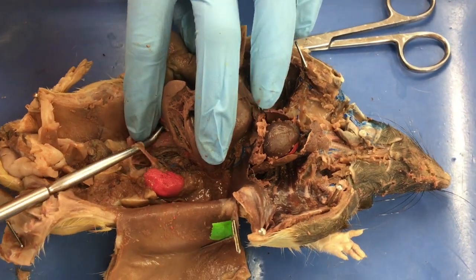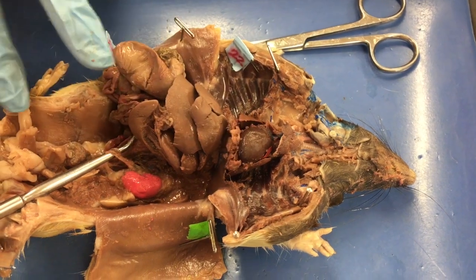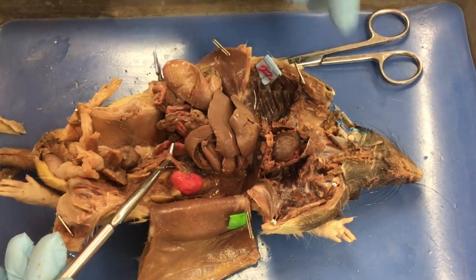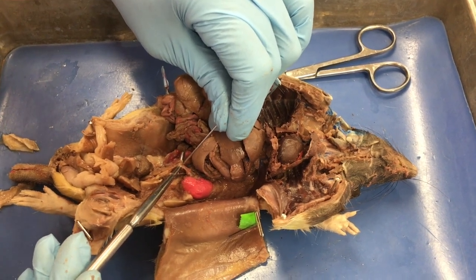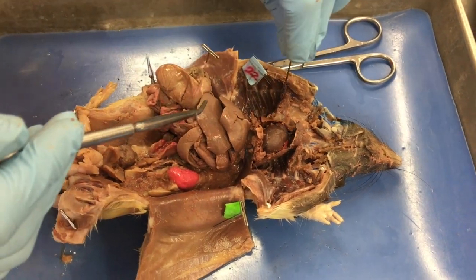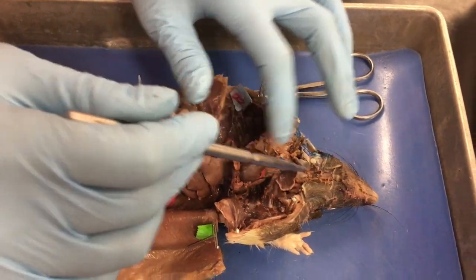So the easiest way to do this is that you look for landmarks. Like I know that's a kidney, so ureters come from the kidneys. So if I have a pin sticking in here, and I say name this structure, you're like, okay, it's coming from the kidneys. This has got to be ureter. Same thing with any of these other structures here.